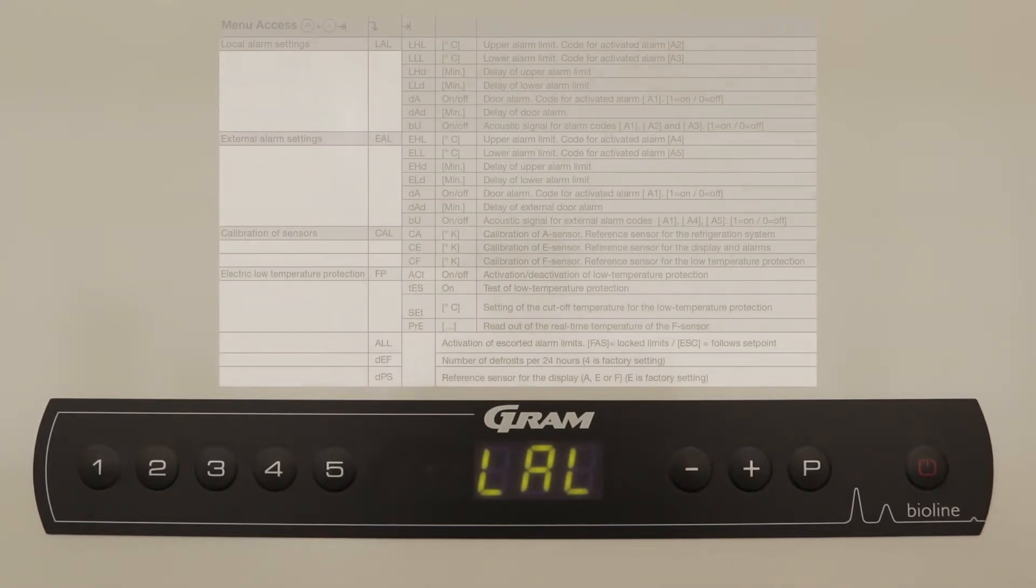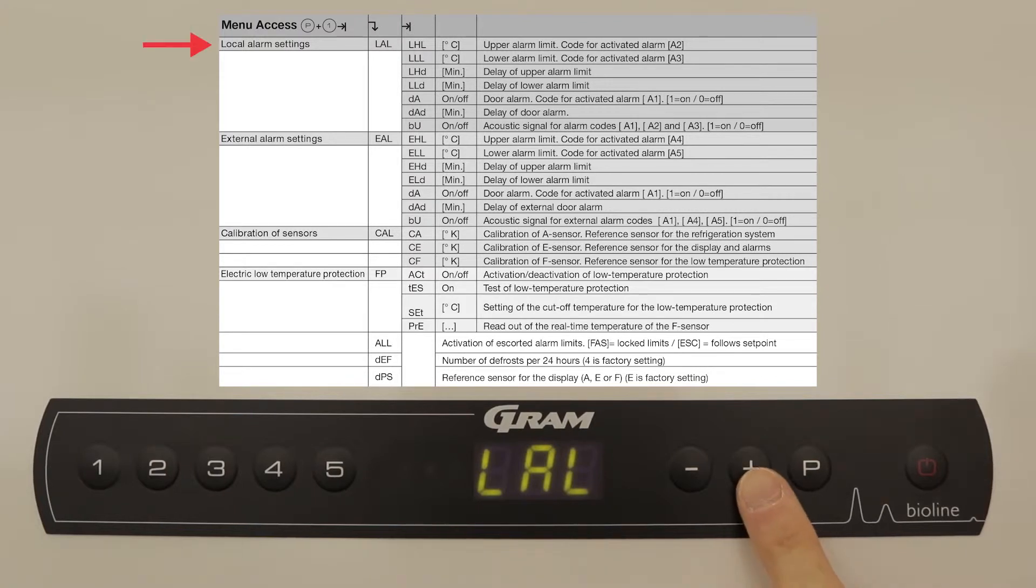You will now have access to the following menu settings: local alarm settings, external alarm settings, and calibration of sensors.